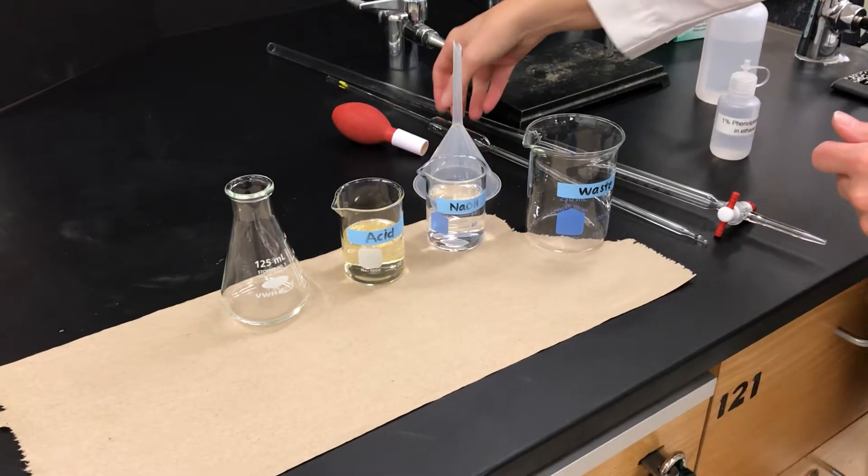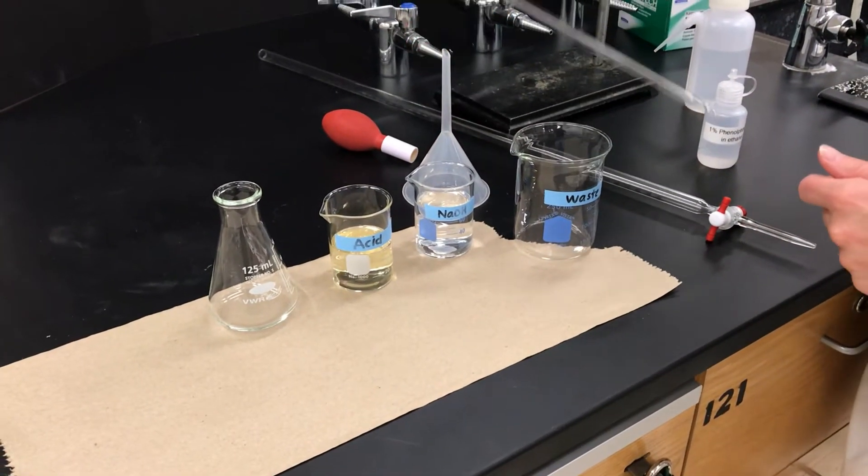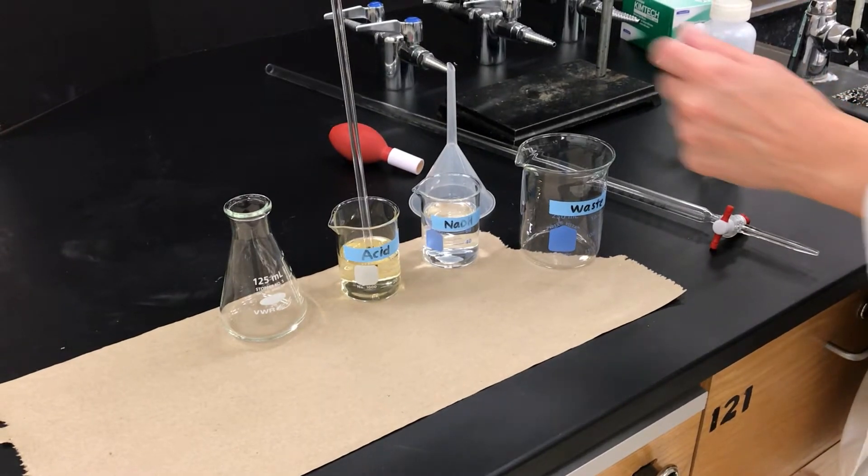In this video I'm going to show you how to do an acid-base titration starting with an acid that's already in solution form.